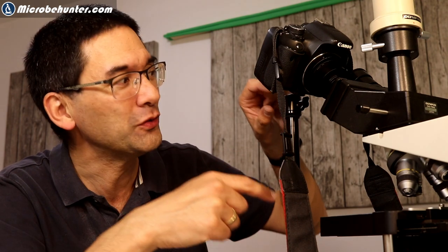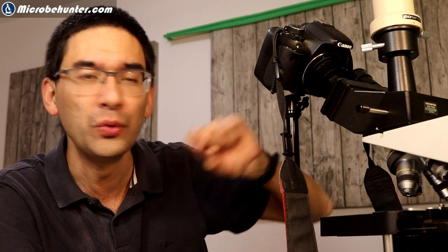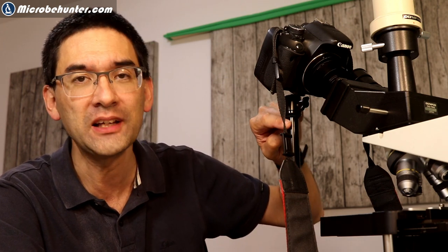This is actually a microphone stand, and I've modified it so I'm able to connect a camera. To do this you need a so-called ball head, which on one side connects to the microphone stand and on the other side has a camera connection. I'll show you later how this looks. The microphone stand is extensible — you can change its length. In my case it wasn't even long enough, so I had to add a second tube and connect two microphone stands together.